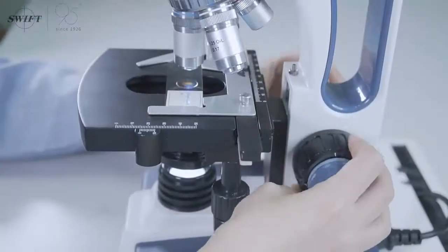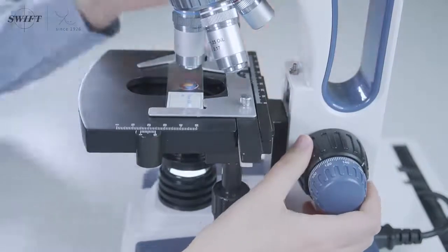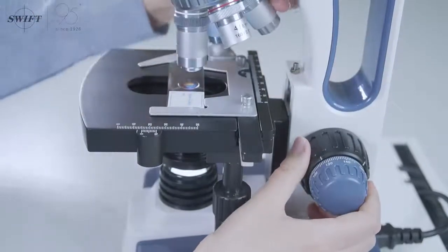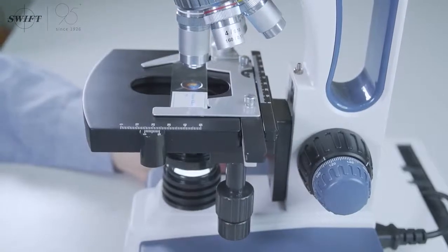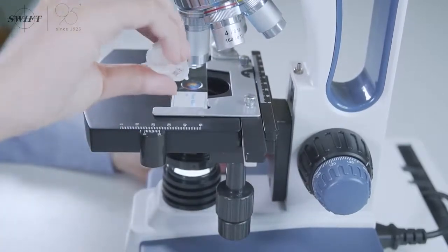For the use of oil immersion objective lens, lower the platform and drop cedar oil into the observation area.